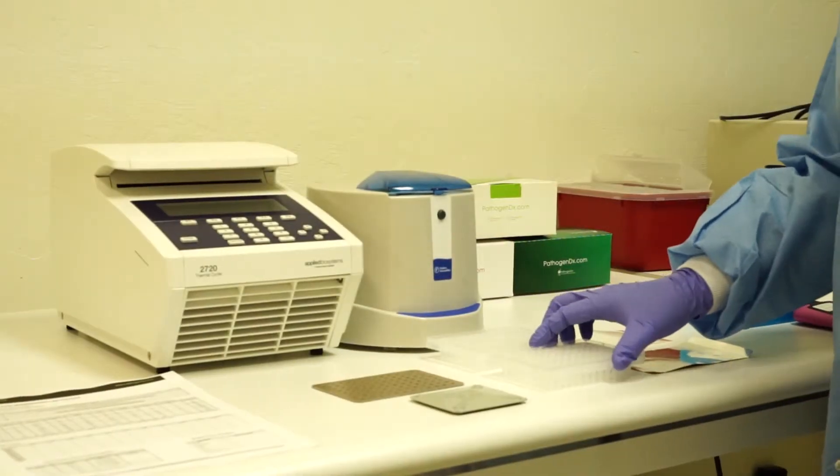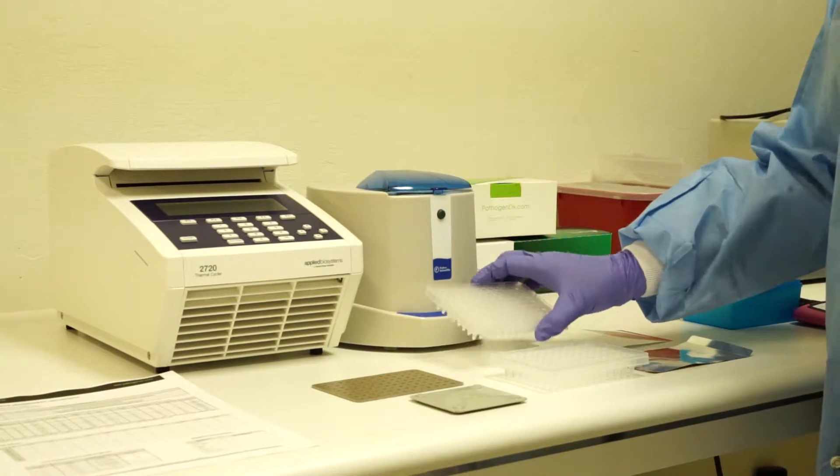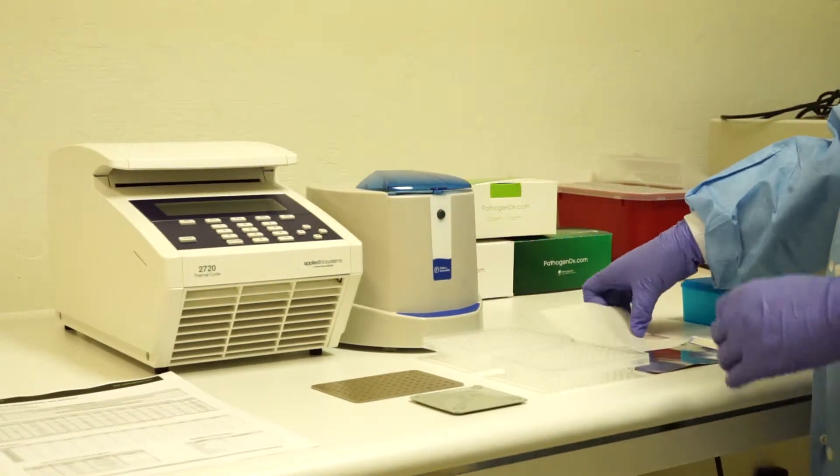Once the PCR product has been moved from the loci PCR plate to the labeling PCR, it may be sealed.